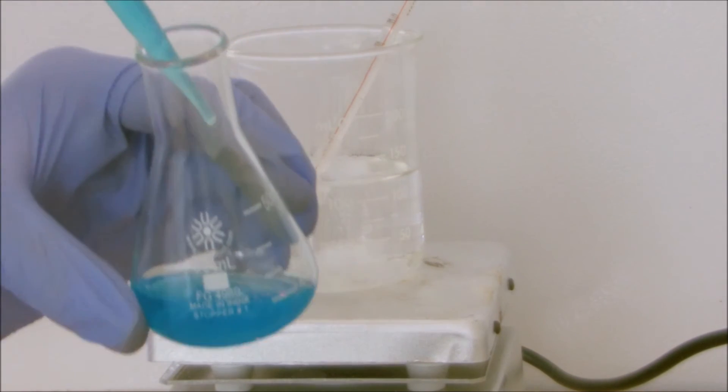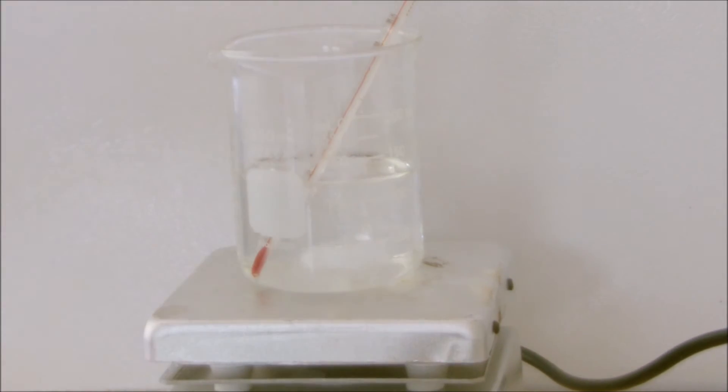That's about good. Now watch the blue color of the copper sulfate.